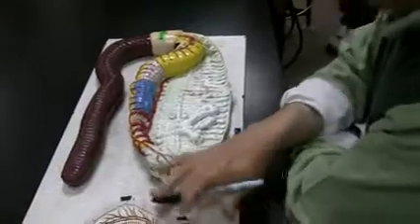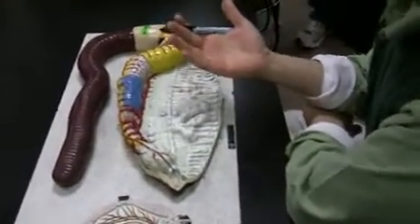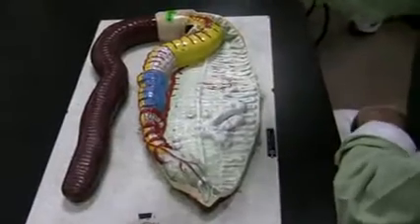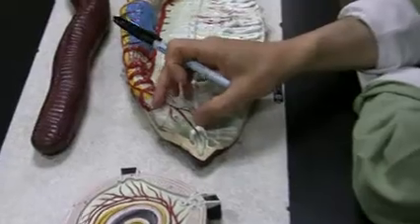Okay, let's talk about the longitudinal cut. We used to have earthworm. I don't know what happened to them. Somebody took them. Well, we don't have it this semester, and we used to dissect them. They're just like this. They're like the dissection we have up there. Okay, but anyhow, mouth here, powerful pharynx.